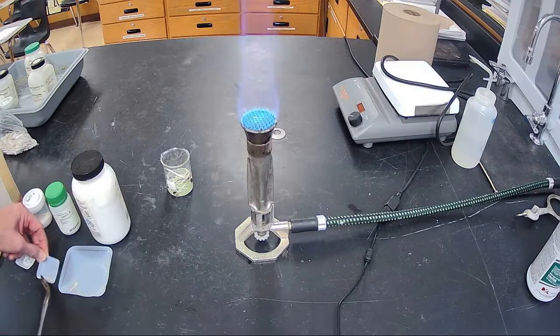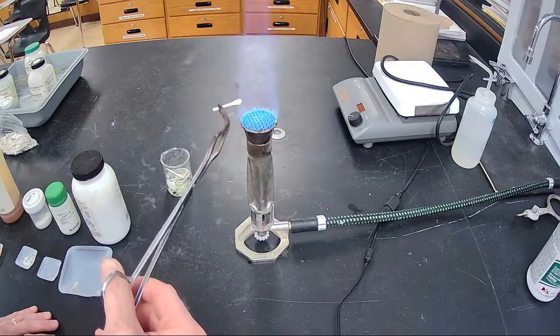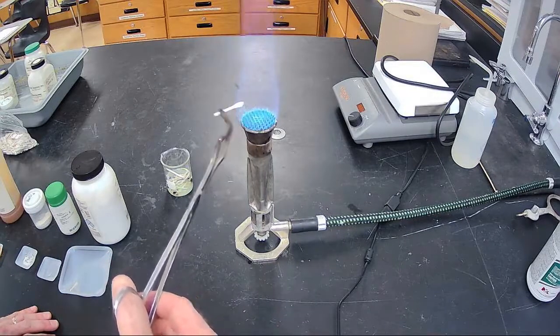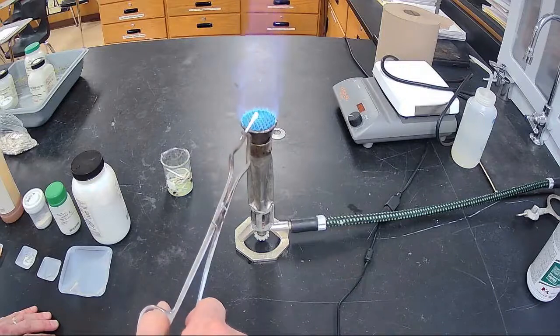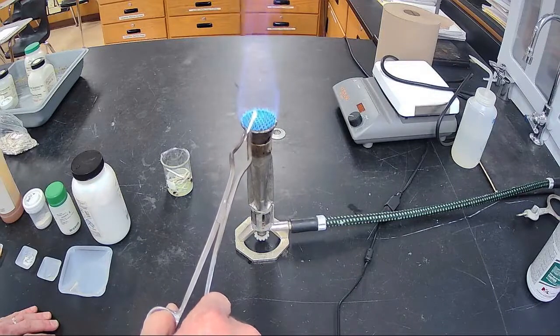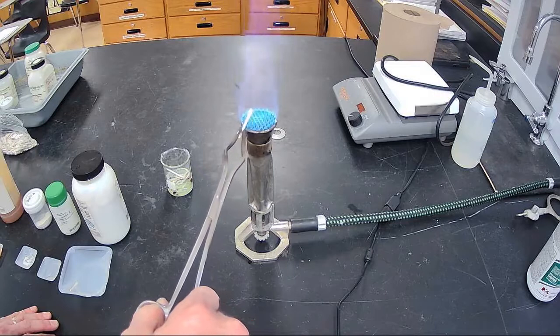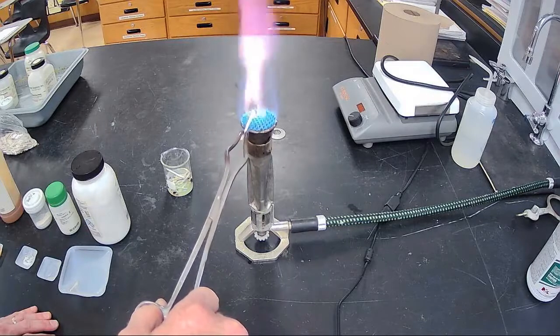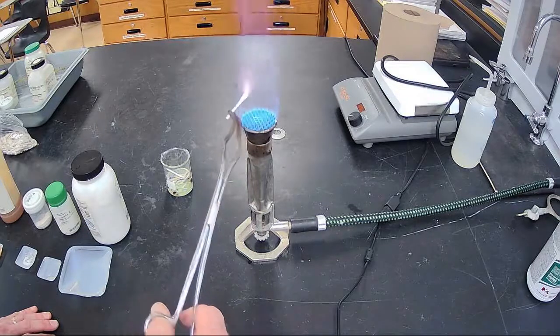Then number 8. Really faint right there. It's starting to burn off just a little bit. I don't know if you can see it when it comes in there. There it is. You can see it's just a slight little, there it goes. It's burning pretty good. A nice pinky lavender color.